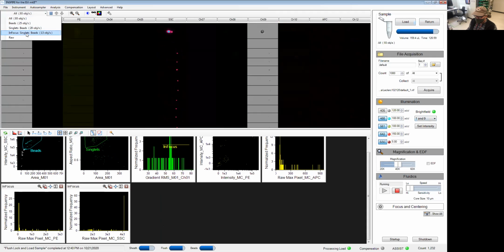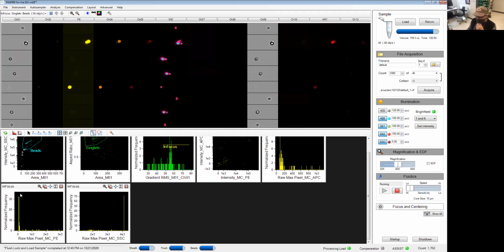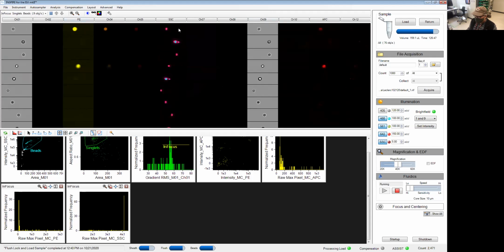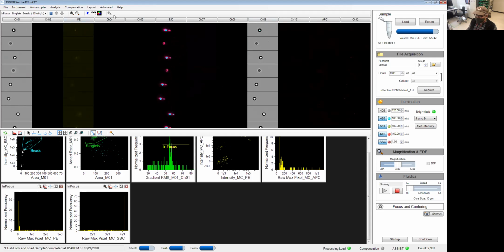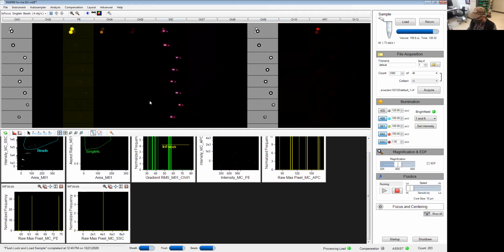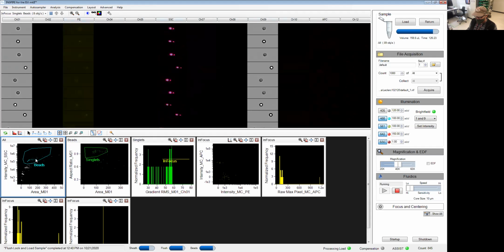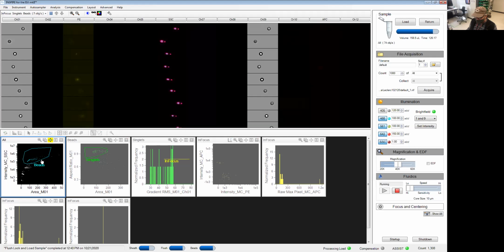Again, as in flow, the important part is going to be to make sure you have separation between your positive and negative fraction when you look at your markers here. And side scatter seems to be pretty high still. I could bring that down 1 milliwatt. Truth be told, I don't care at all about the side scatter of my beads. So I might just leave it as it is. Obviously, if you change the laser power and go back here, you'll see the population move. So I can readjust my gates simply by pressing this move resize region. It will allow me to adjust the gate.